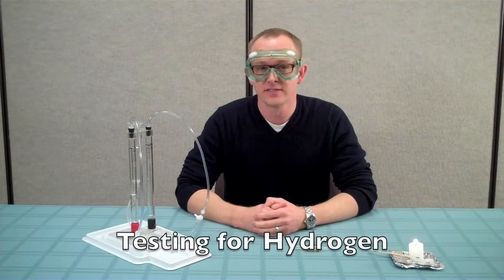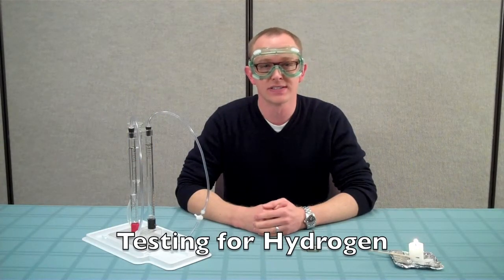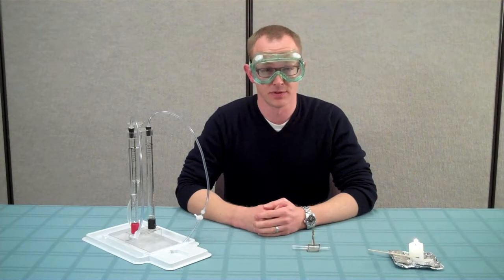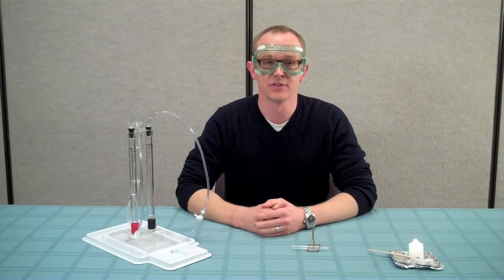Finally, we can conduct tests to identify the gases. We know that hydrogen is less dense than air and flammable, so we will try to ignite hydrogen captured in an inverted test tube.